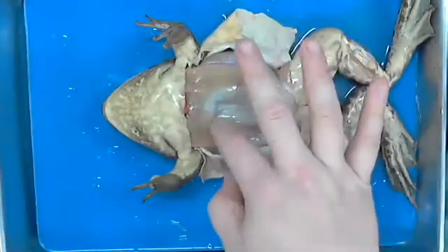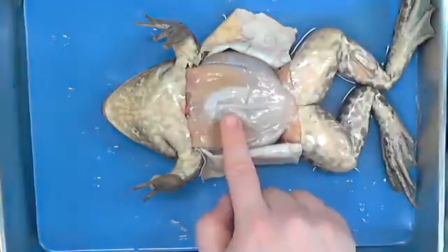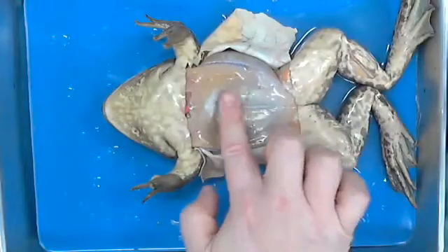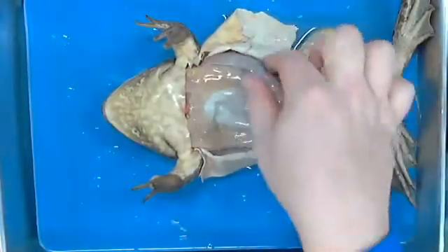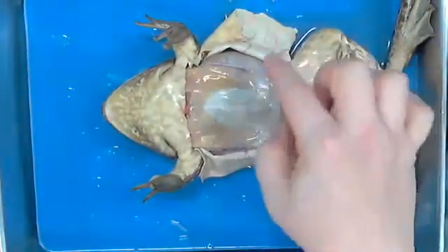So this is nothing but muscle, okay? The same thing you and I would have. He has far more musculature. You can see the white area. He has far more musculature here, right in the dead center, than he does on this outside. If you were touching like I was, this feels much thinner. This feels like it's thicker. It's not by a lot, but it's definitely a difference.